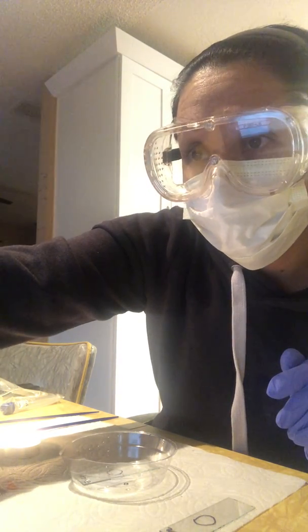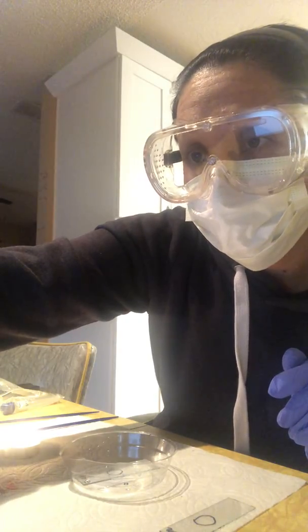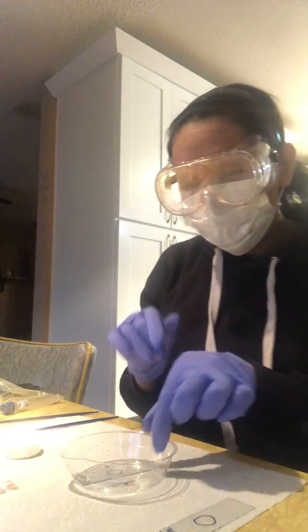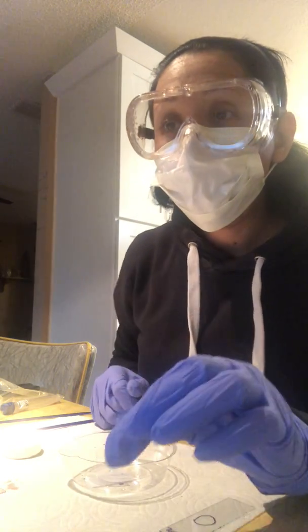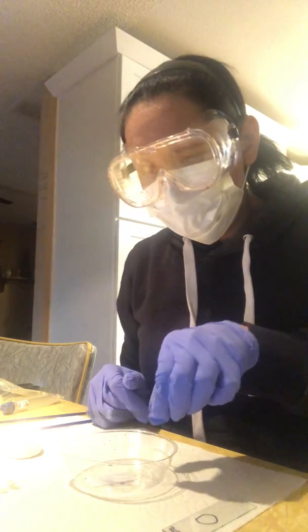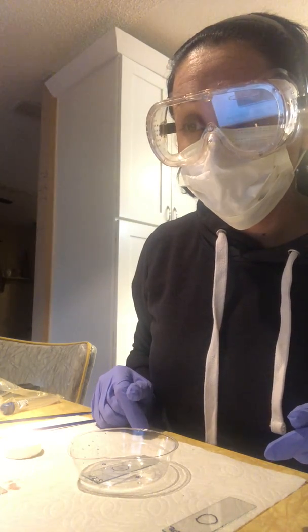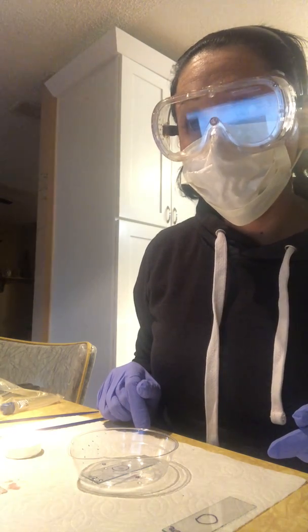And I already put it over the heat. Repeat steps 1 through 11 for Cerevisiae and epidermidis. Okay, so I'm not going to do that for the E. coli. I'm just going to let it sit dry. But for the epidermidis, I'm going to take it and put it in my staining dish. I'm going to place the sample side up on the staining tray.